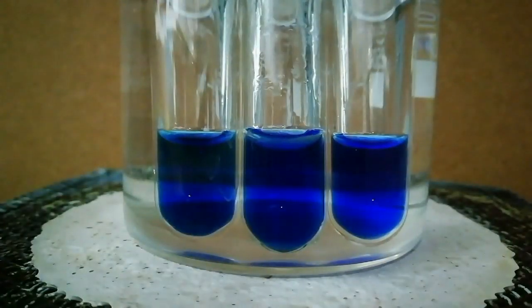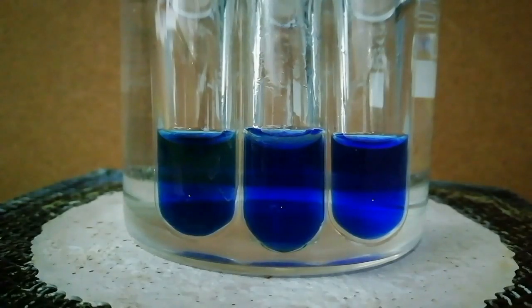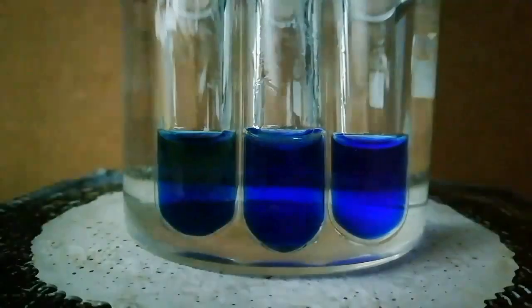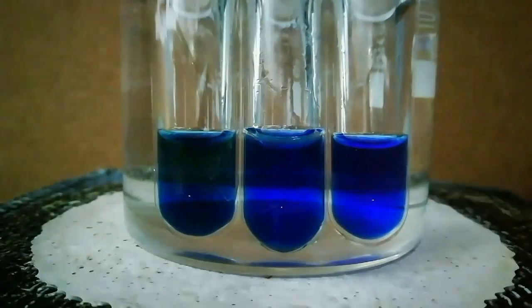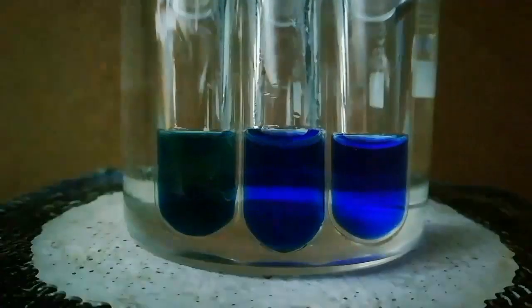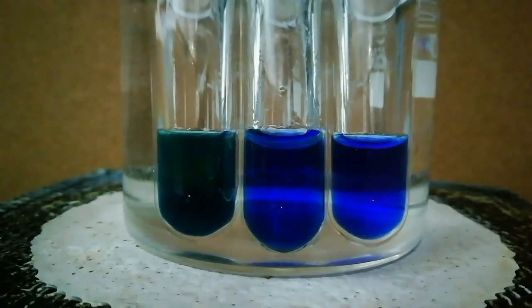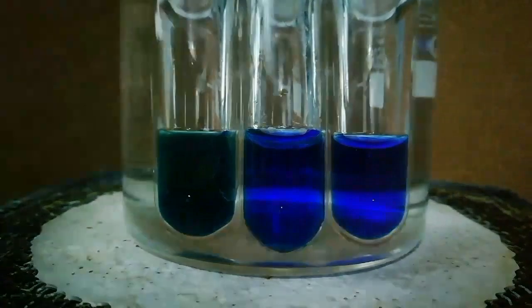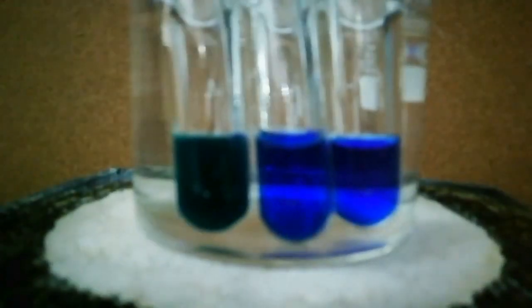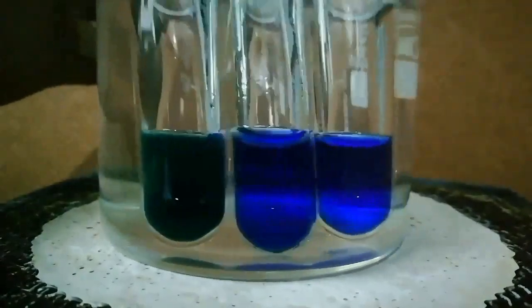After a few minutes only one test sample gives a color change. The aldehyde is oxidized to a carboxylic acid and copper(II) ions are reduced to cuprous oxide, which is a red color precipitate.